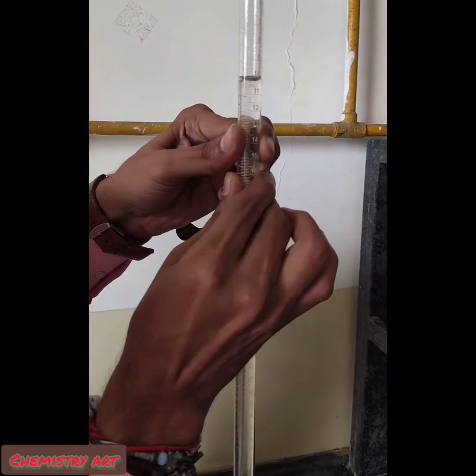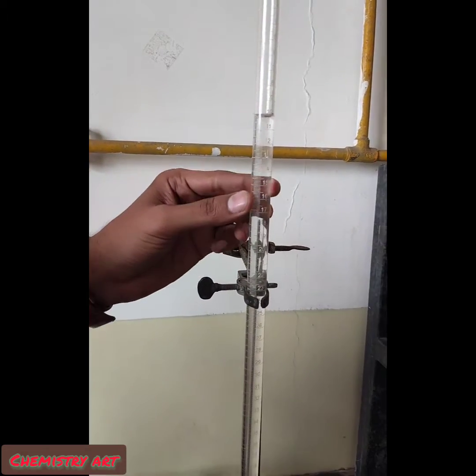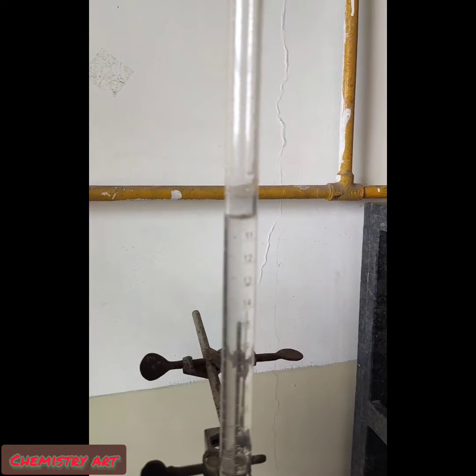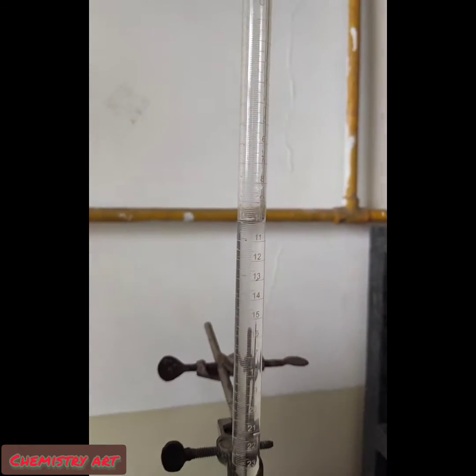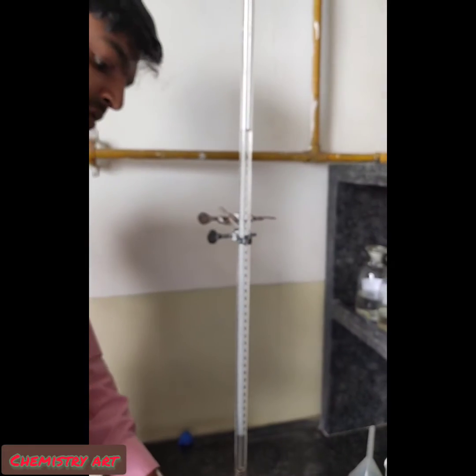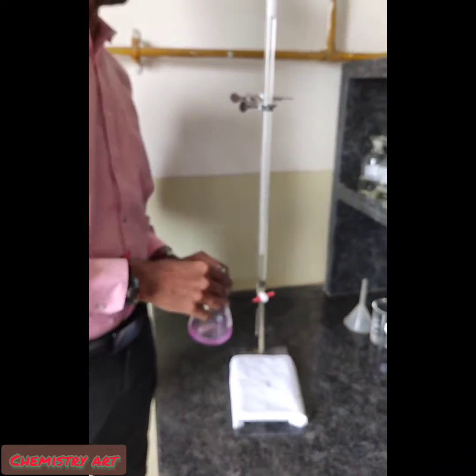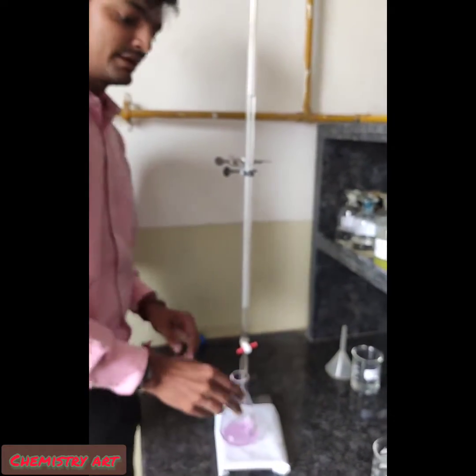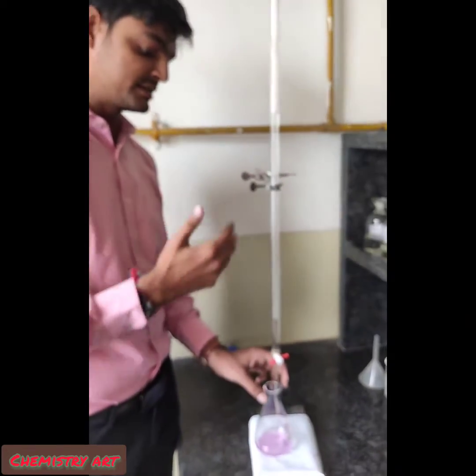Now check how much solution was used in the burette. The lower meniscus reads exactly 10.1 ml. This is my first reading: 10.1 ml. We have to take a total of four readings and from those select the concordant reading.